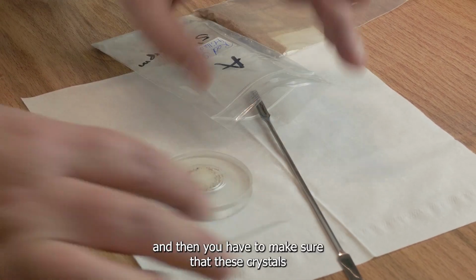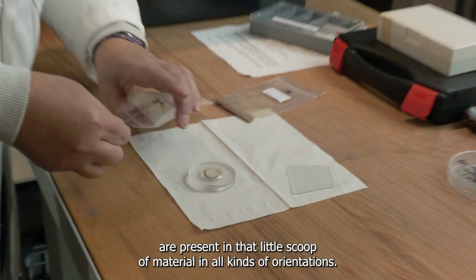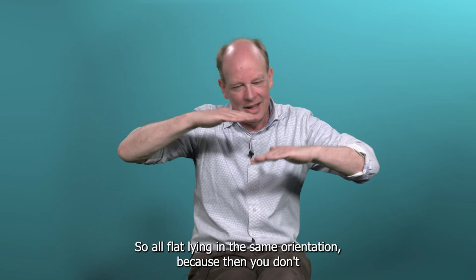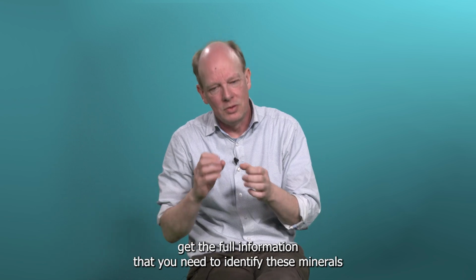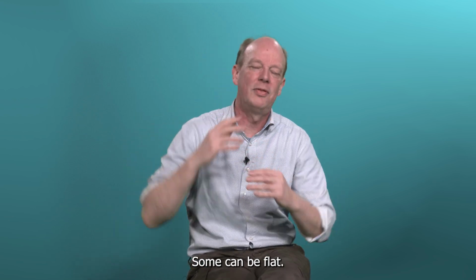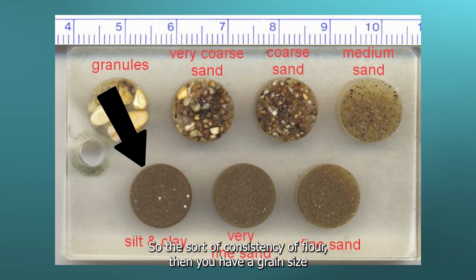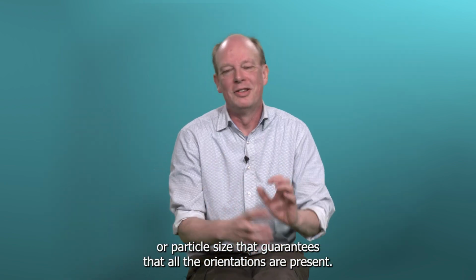And then you have to make sure that these crystals are present in that little scoop of material in all kinds of orientations. So if you can imagine that you have a flaky mineral, then you don't want them to all be aligned, all flat lying in the same orientation, because then you don't get the full information that you need to identify these minerals. If you have a flaky mineral, some need to be like that in the sample holder, some need to be like that, some can be flat, and you only achieve that if you make a really, really fine mixture, so the sort of consistency of flour. Then you have a grain size, a particle size that guarantees that all the orientations are present, if you like.